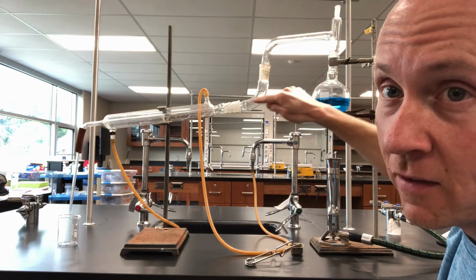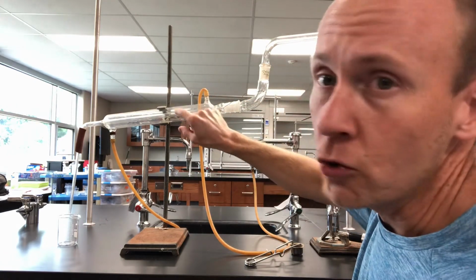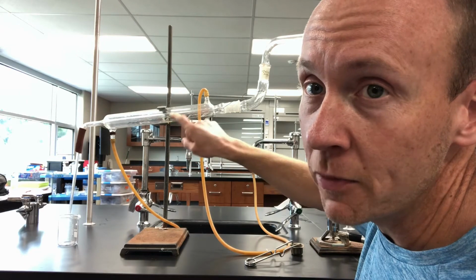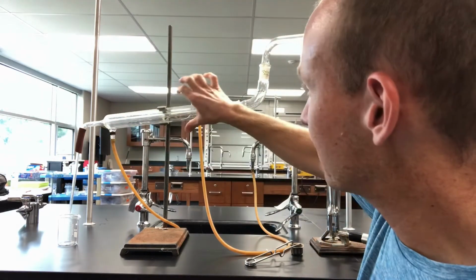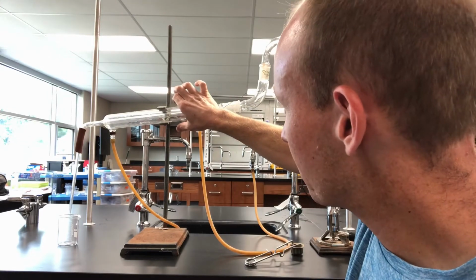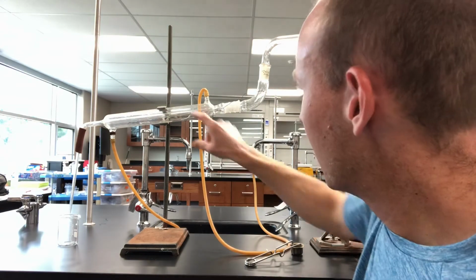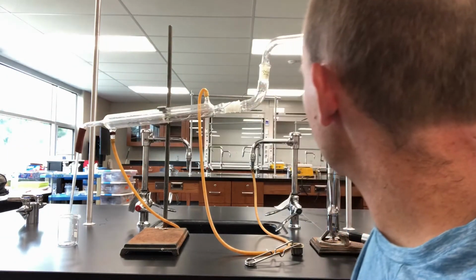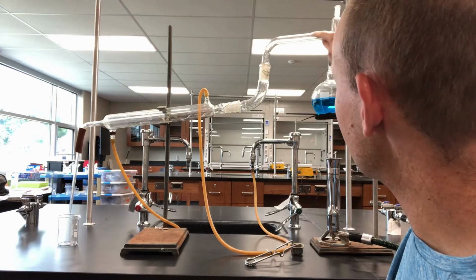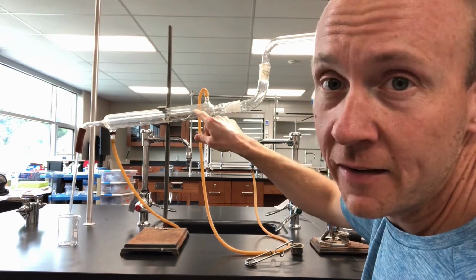And then when it gets down to this inside, to this tube right here, there are two tubes. I don't know how clear it'll be on the video, but there's this inside track that connects clear through to the other end. Then there's this outside part that I'm going to be pumping in some water from the sink. It's going to cool off this zone right here. And then what happens is, as the steam rises up and passes through this channel, it's going to reach this area where the cool water on the outside is going to cool it.